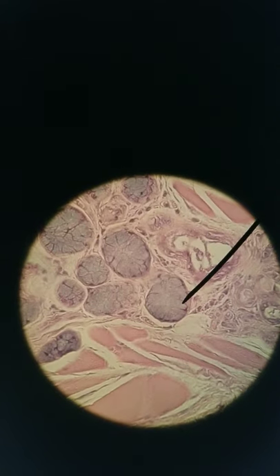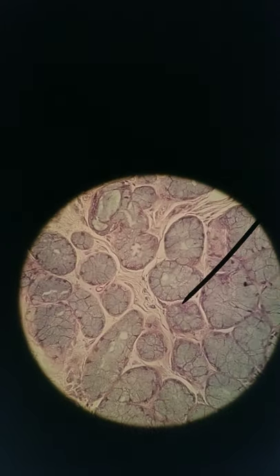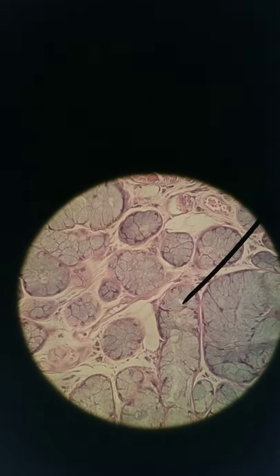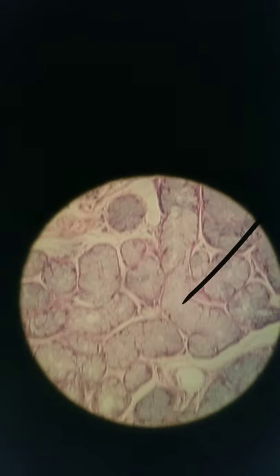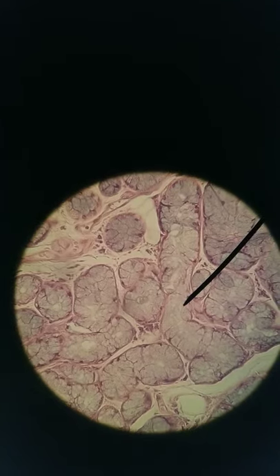Where you can find predominantly mucus cells and no serous cells, or not as many, this is the sublingual salivary gland. Sublingual, as the name implies, is found underneath the tongue. Sublingual releases mucus saliva for lubrication.